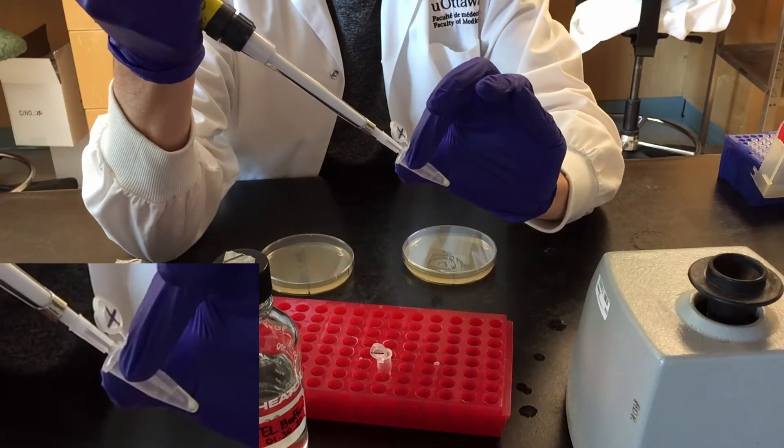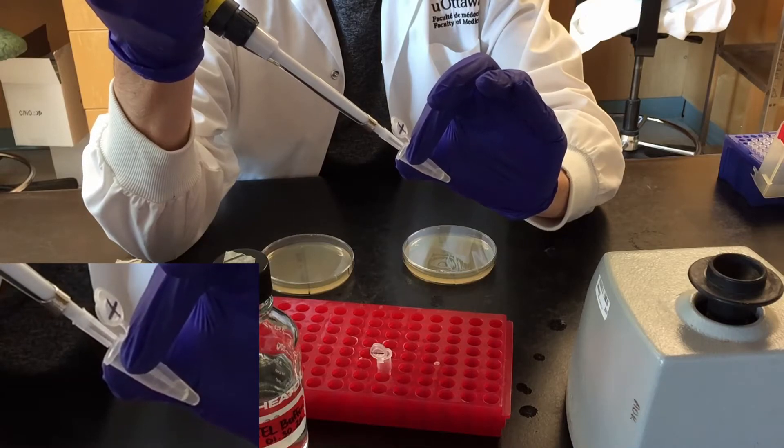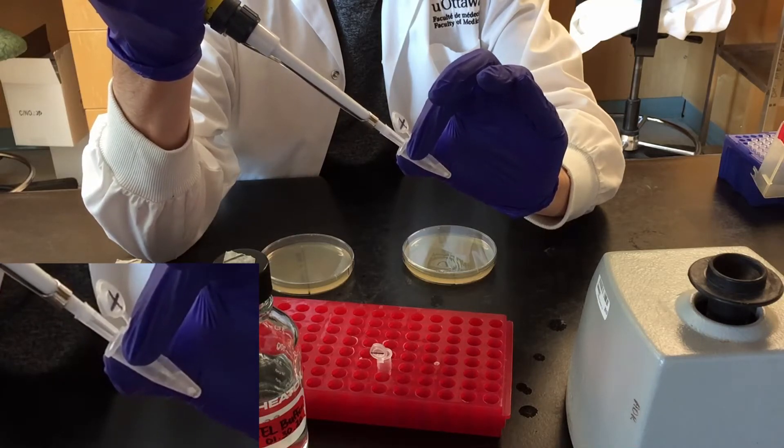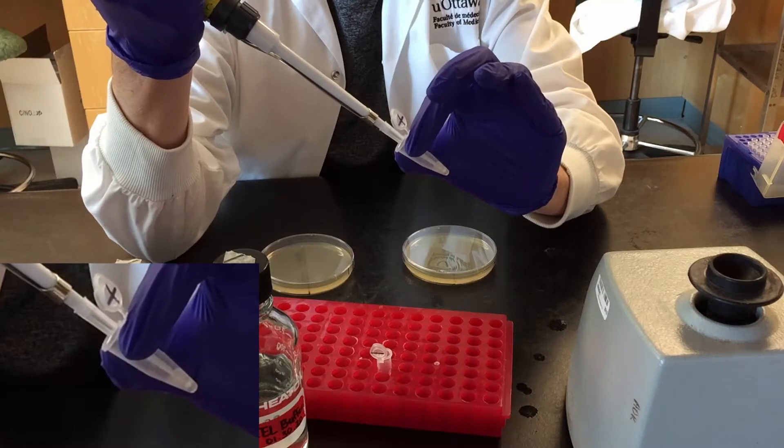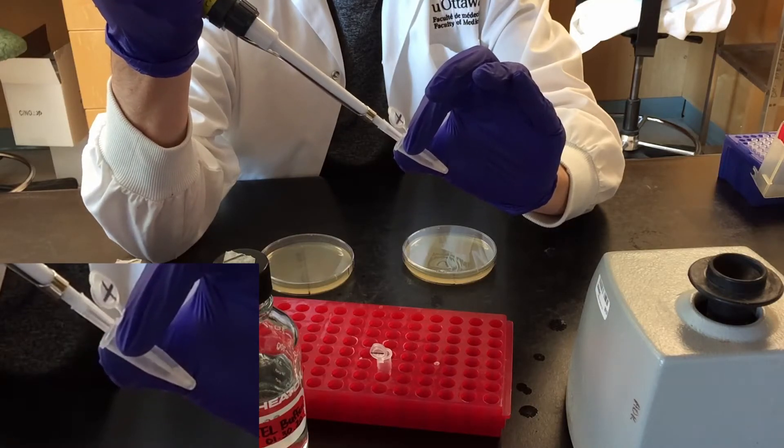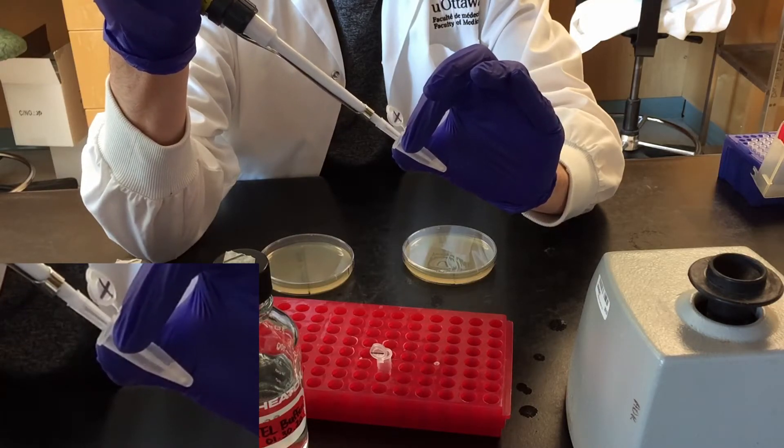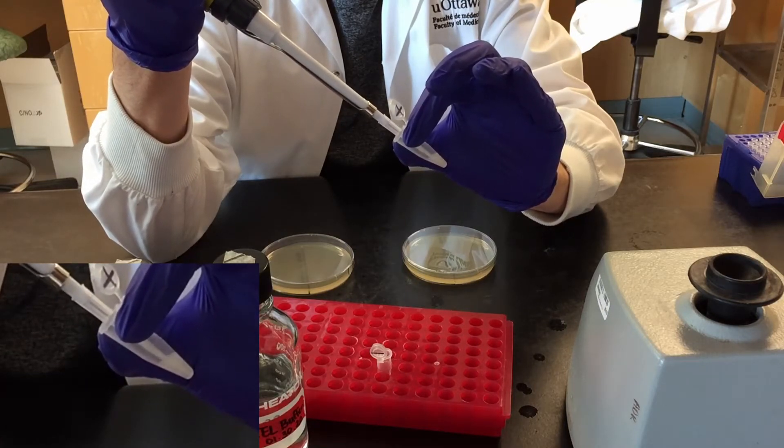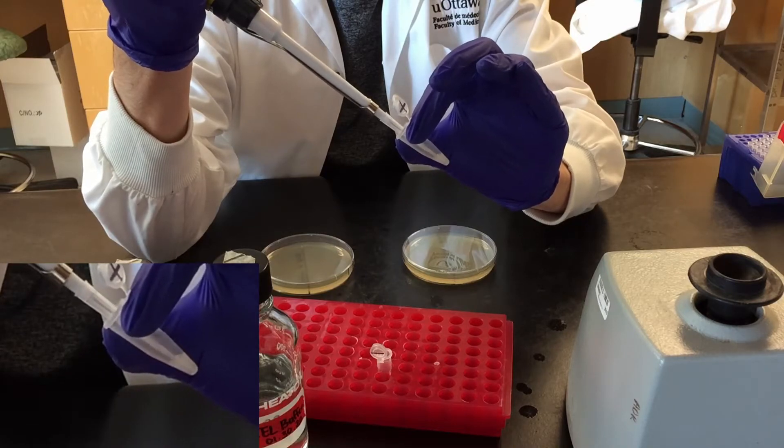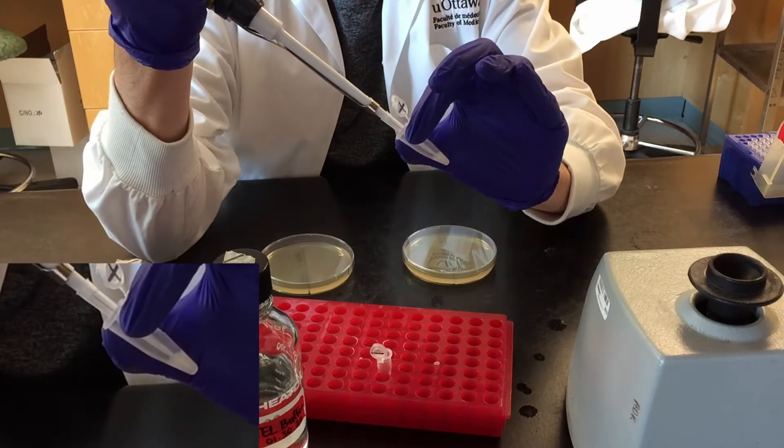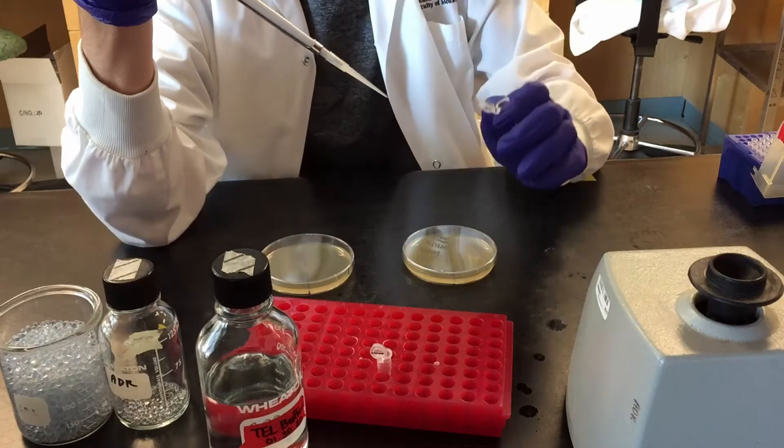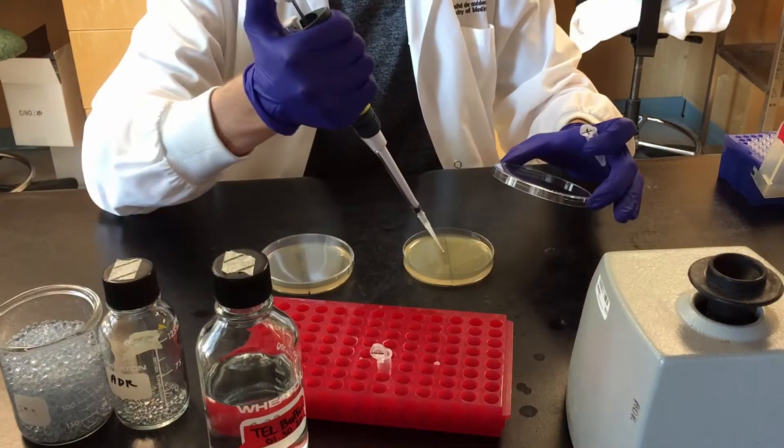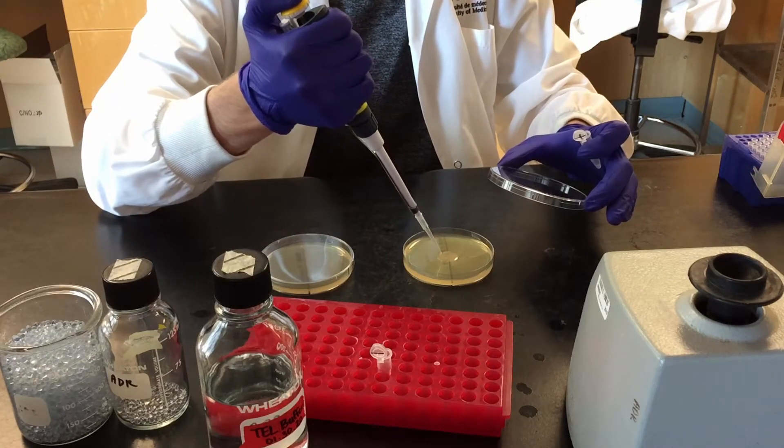Resuspend the cells in Tel Buffer, which can be tricky if there is a lot of solidified peg mix. Plate the full volume of resuspended cells on YPD and spread with glass beads.